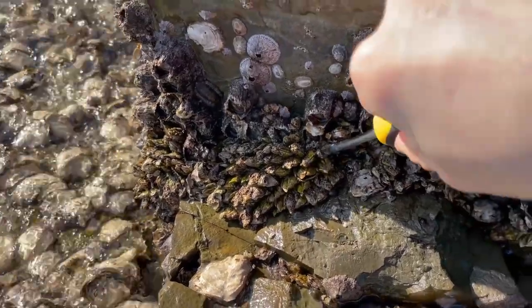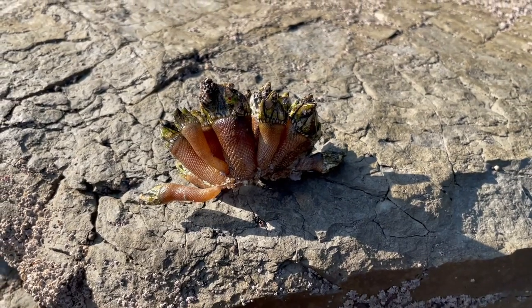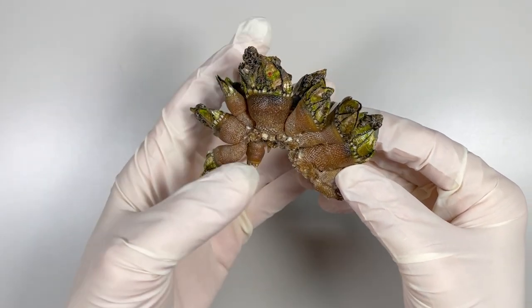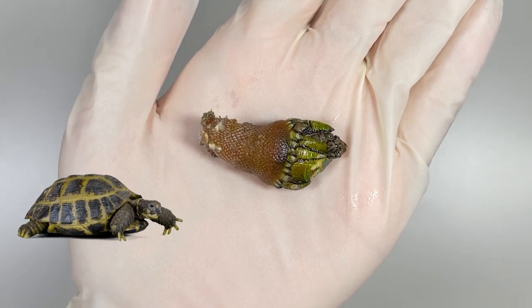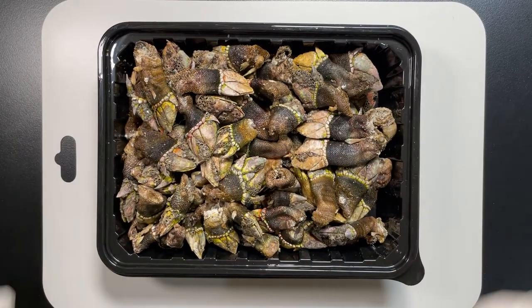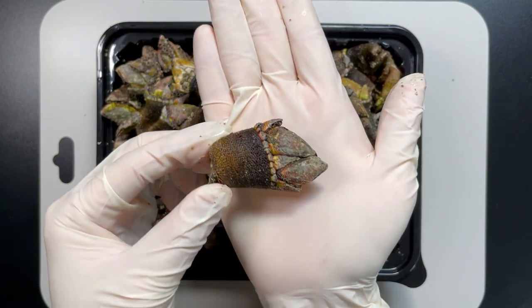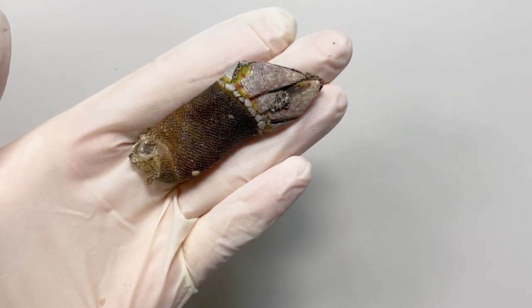If you take off the bottom of the rocks, you can get it easily. They usually live in groups, but if you take one off, you can see that they look very much like a turtle's hand. Since these are small, I bought a large one for better observation. Gooseneck barnacles have various shapes, from thick to long. I picked one and looked at its shape.